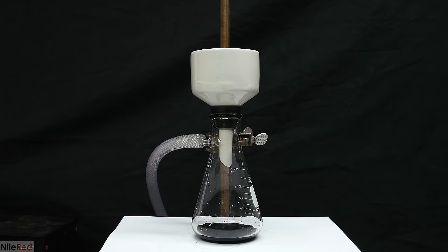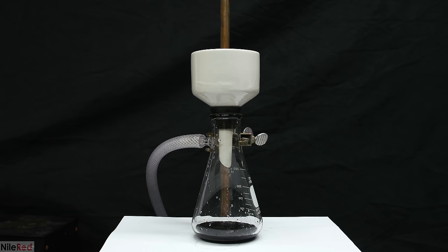The first filtration is still going to be full of nickel boride, and to clear things up, we're going to have to do a second filtration. Once everything has come through, I transfer everything in the filtration flask back to the beaker, and I pour it through the same filter paper.